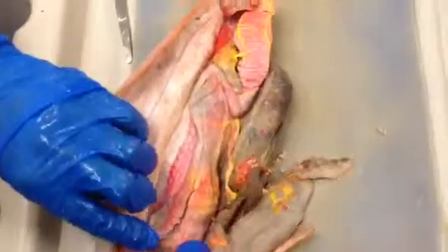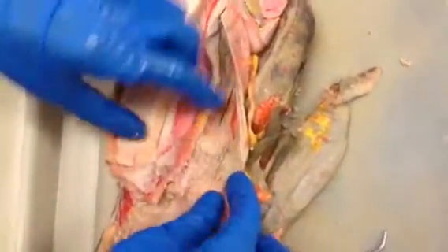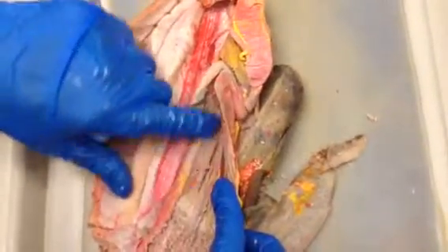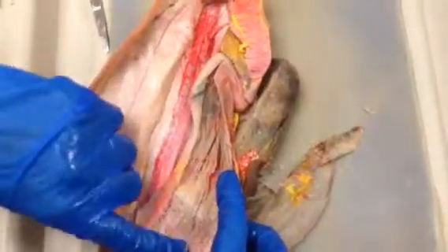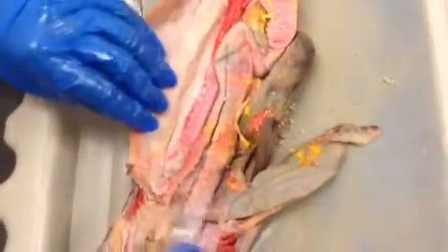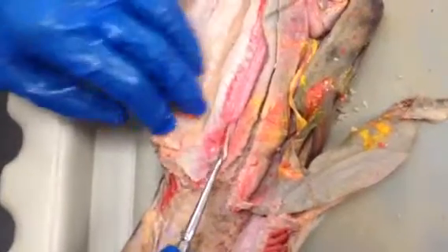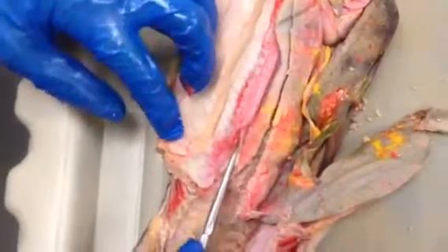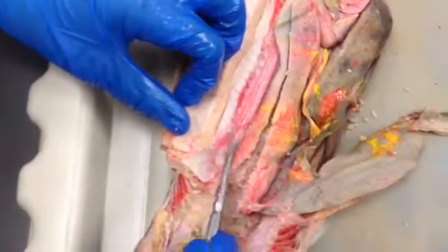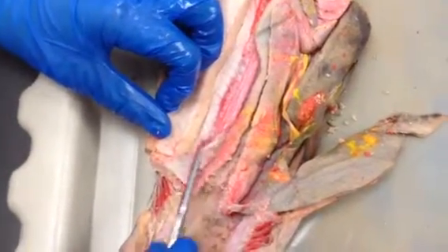the stomach. We cut open the esophagus here so you can see the papillae of the esophagus. When that transitioned into these flat folds that are called rugae, then it's now the stomach, whereas esophagus has the papillae here. Okay? Next to the esophagus, on the side here, is the testes, and then the mesentery attaching, I'm just going to do the mesenteries at the same time. The mesentery attaching the testes here is called the mesorchium. If that was an ovary, it would be called a mesovarium.